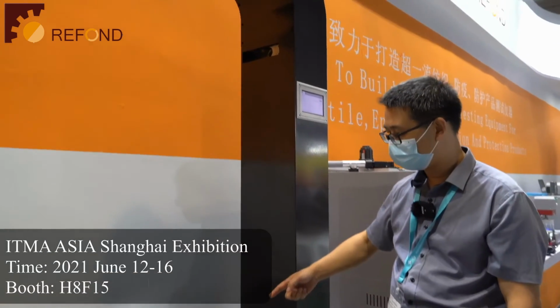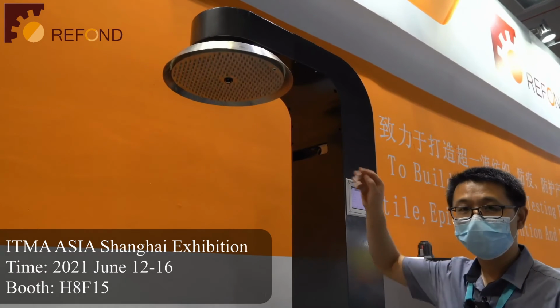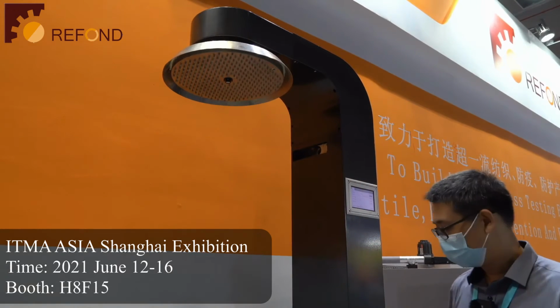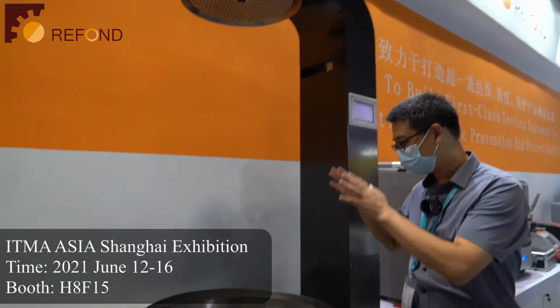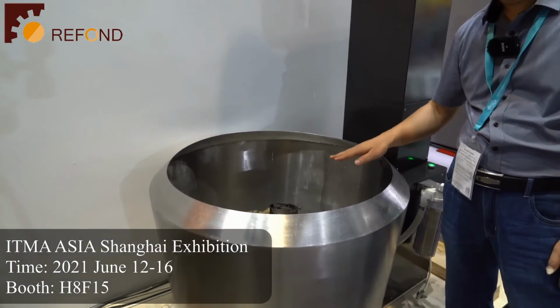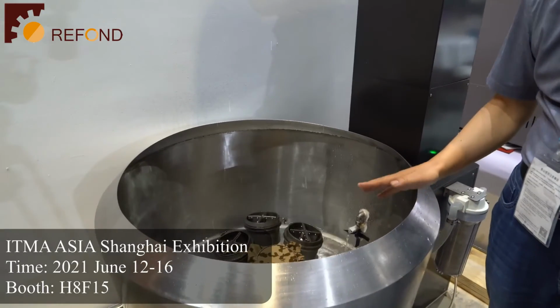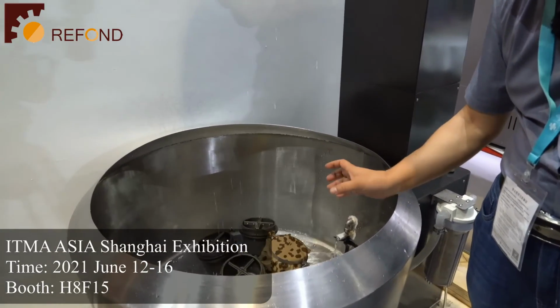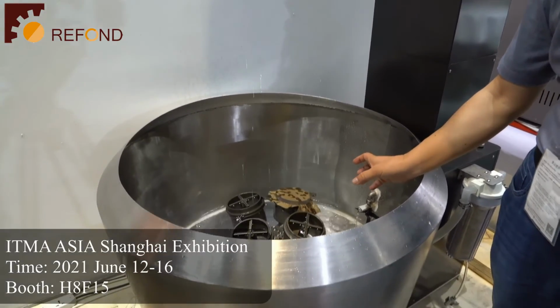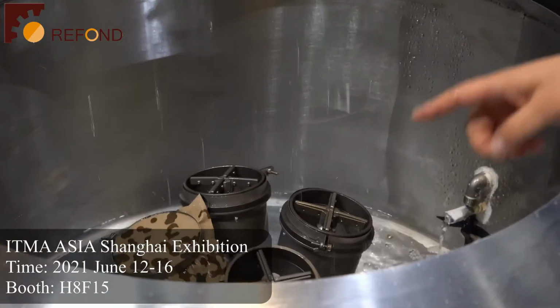This machine simulates the rain drop from 1.5 meters high. The water is dropped on the top surface of the specimen. Right here, the specimen is mounted on the water cup, and the underside of the specimen has a wiper.